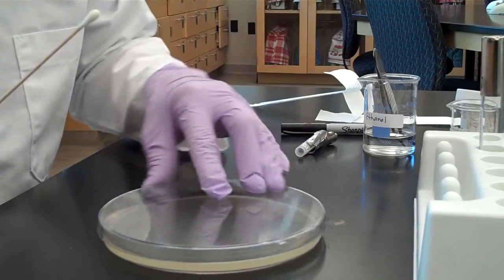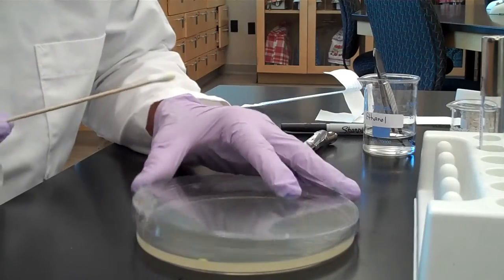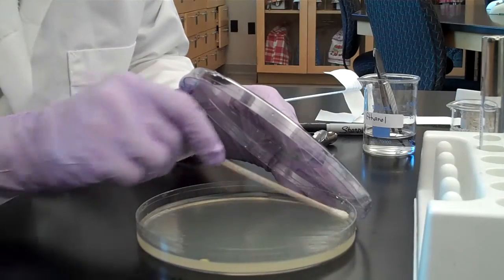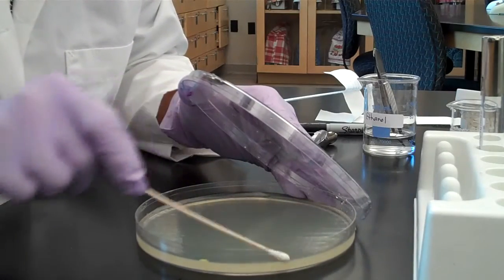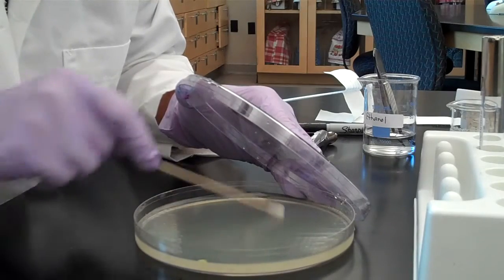Now turn your plate 90 degrees and swab again. Back and forth, so that you cover every little bit of that agar.